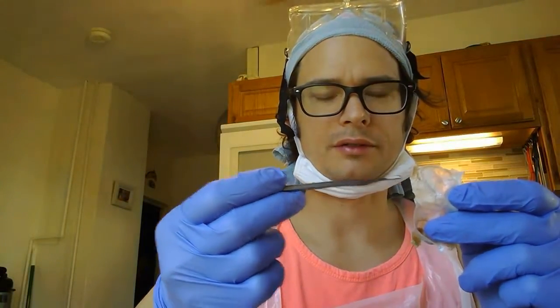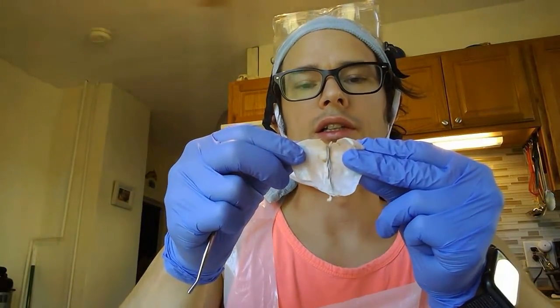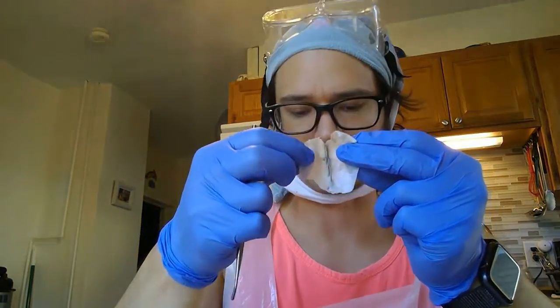I will also show the meninges that I removed. So I got the pia mater right here. I had a bit of a sheep brain actually that it was attached to. I could see the subarachnoid as well, carrying some vessels, and the tough layer, the tough mother, was the dura mater as well. And here's a piece that came from over the longitudinal fissure, and you can even see the vein that was running through it.